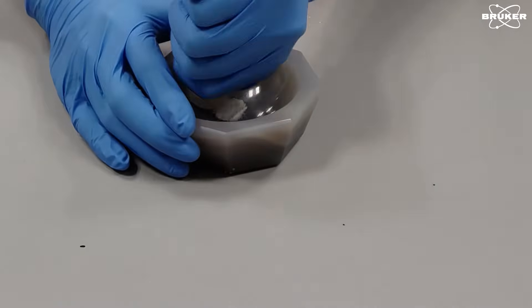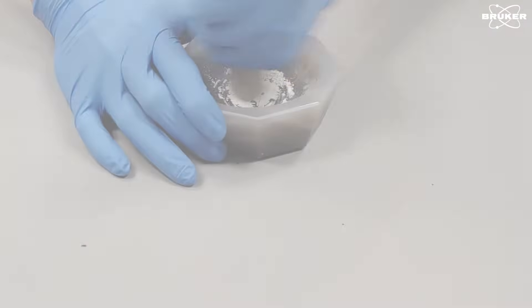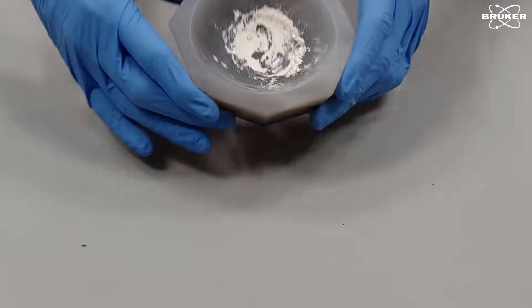Also remember that KBR is hygroscopic. Grind carefully and thoroughly but not too long.